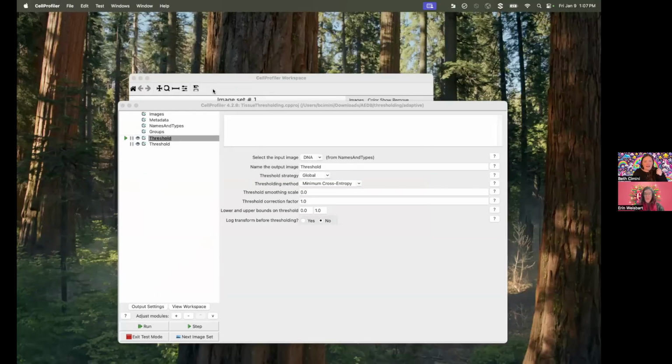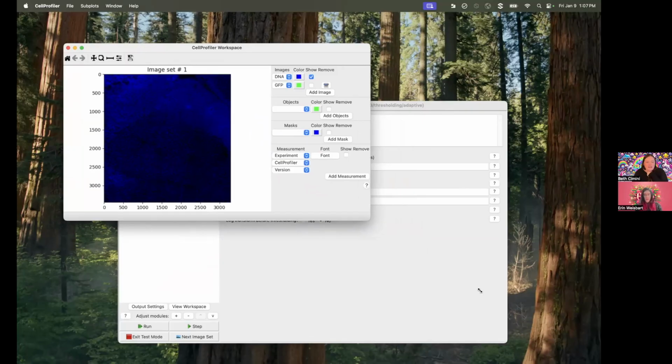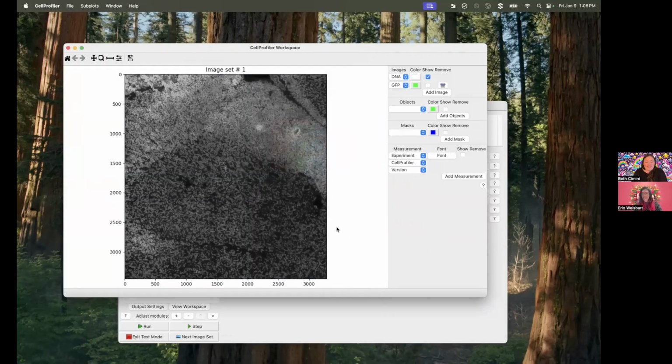So I have taken the liberty of loading up Susan's images into CellProfiler, into the workspace viewer. And so here it is, being a little bit slow and cranky because these images are a touch big, and CellProfiler was born in a 256 by 256 world. CellProfiler is a little cranky on stitched images, but thankfully this isn't too big. Even though everything is white because that's the default, though not in CellProfiler 5, you can definitely get a sense of brightness: here things are much brighter and here things are much dimmer, which is exactly what Susan described.